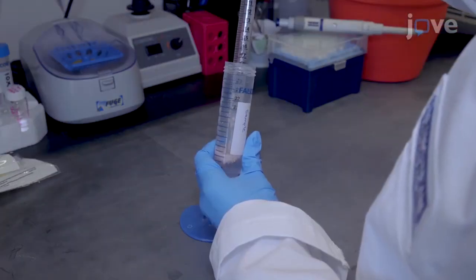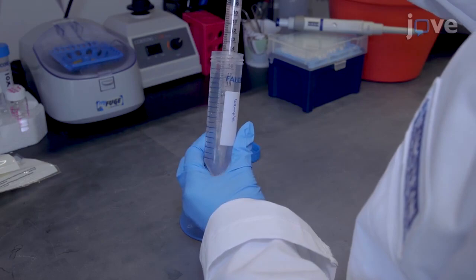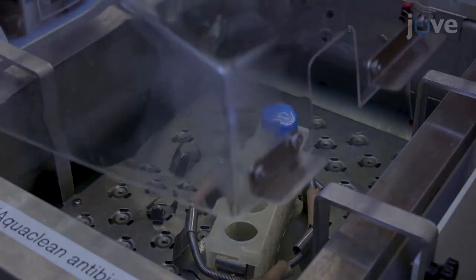Pipette the sample up and down several times. Then incubate it for 12 to 15 minutes at 37 degrees Celsius while shaking.